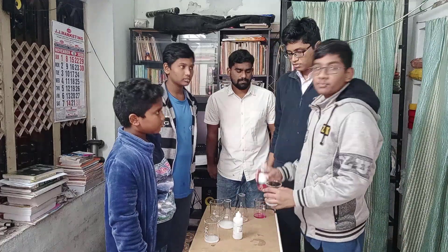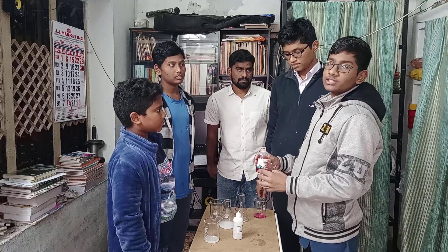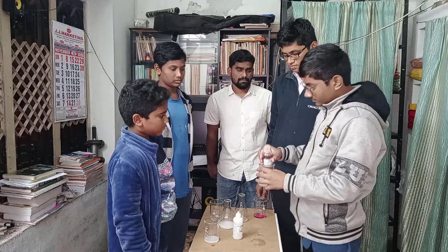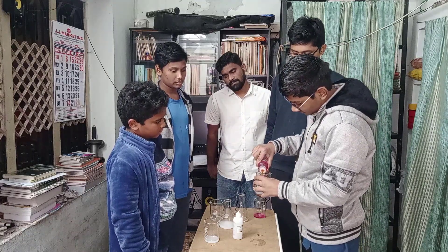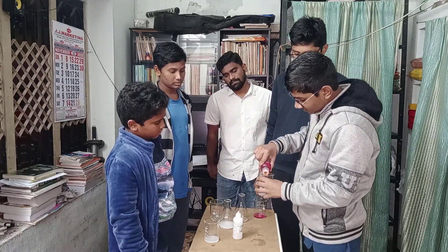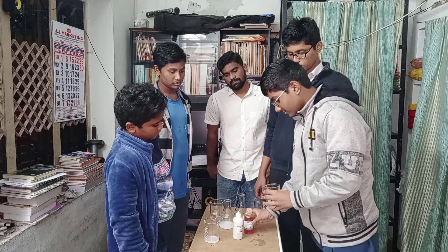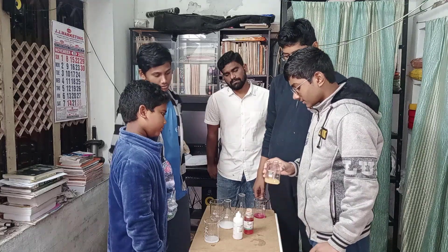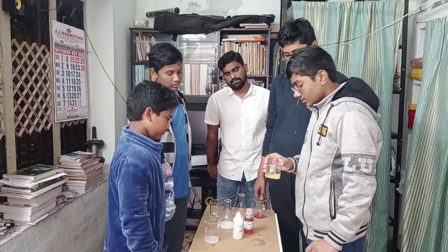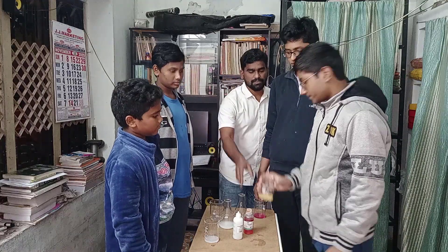Now we are pouring methyl orange in the base. It turns into yellow color.